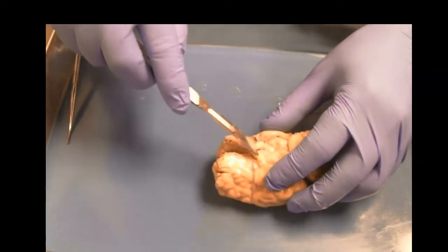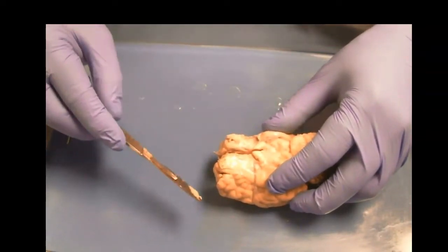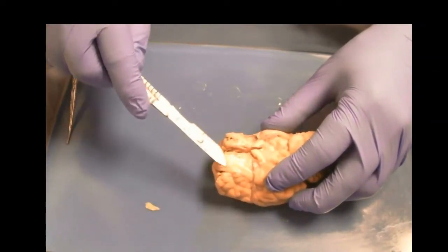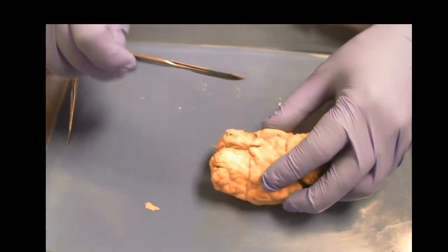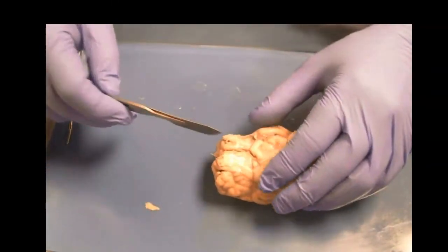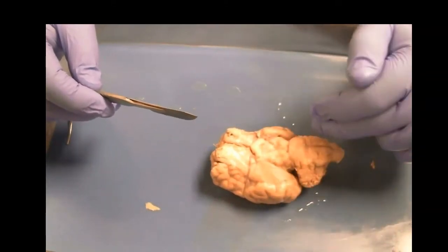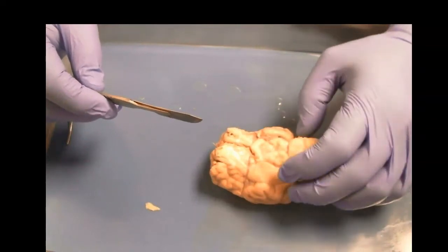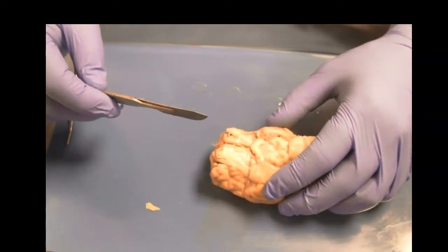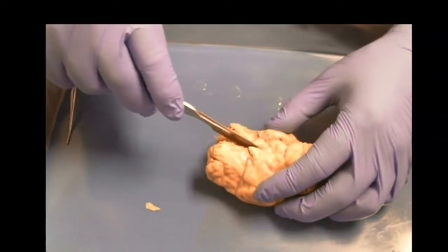Now on the bottom of the brain, I've cut through this white matter structure right here. This is the olfactory nerve. I'm sorry, the optic nerve. This is cranial nerve number 2. Olfactory is 1, cranial 2 is the optic. And this is where you have the optic chiasm, where the nerves from the left and right eyes cross, so that the visual field information goes to the opposite side for processing in the occipital lobe. The right visual field goes to the left side of the brain. If you were to cover one eye, you would see that you still see left of center with your right eye and right of center with your left eye. This information crosses here.